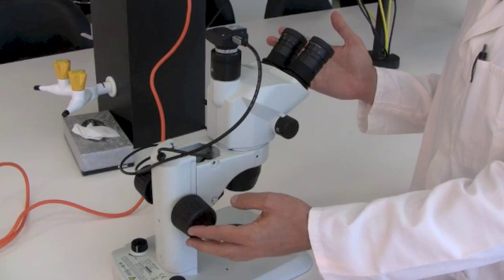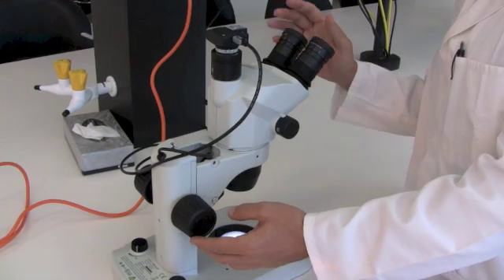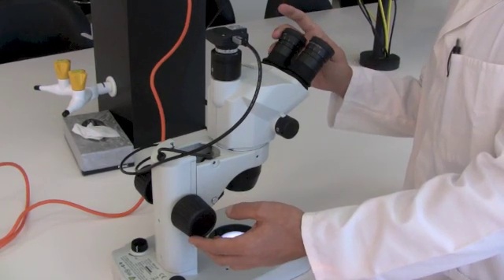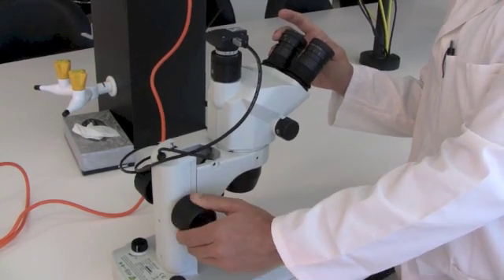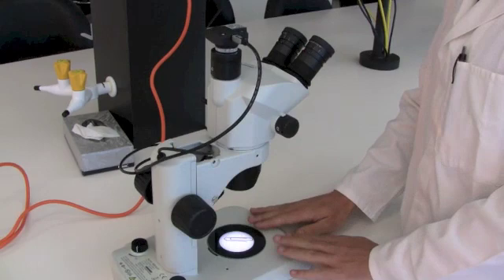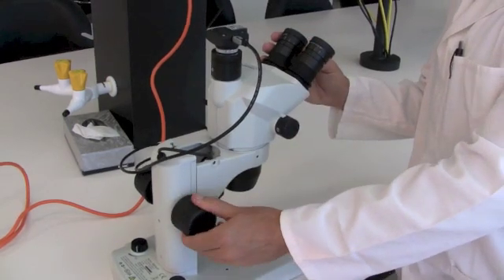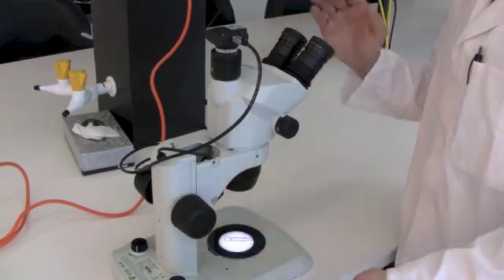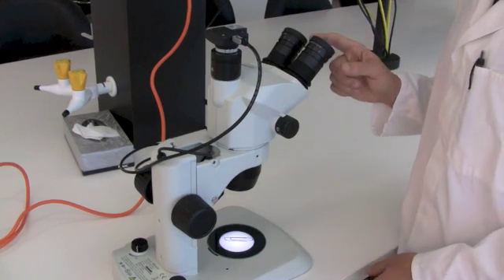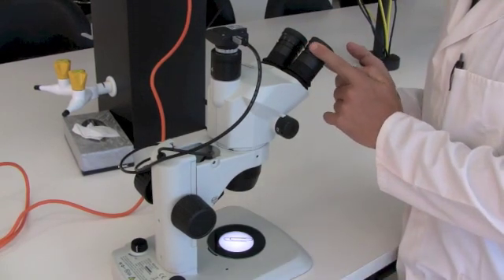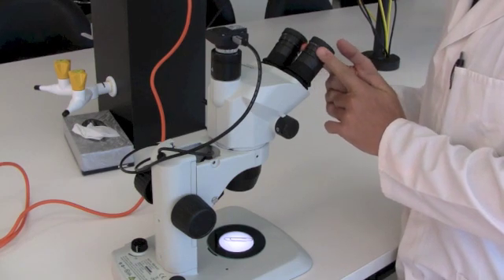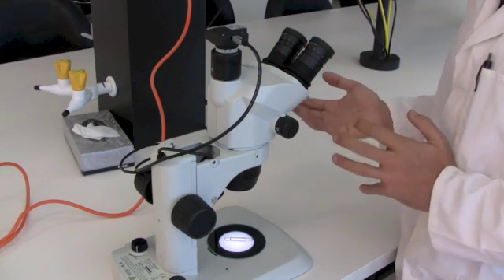To get this in the right magnification and focus, put your right eye up here. Close your left eye and use the focus knob to bring whatever image it is into focus in your right eye. Once that's in focus, you can switch to your left eye. Open your left eye and close your right, and then adjust the eyepiece. Once that's in focus, both of your eyes should be in focus.